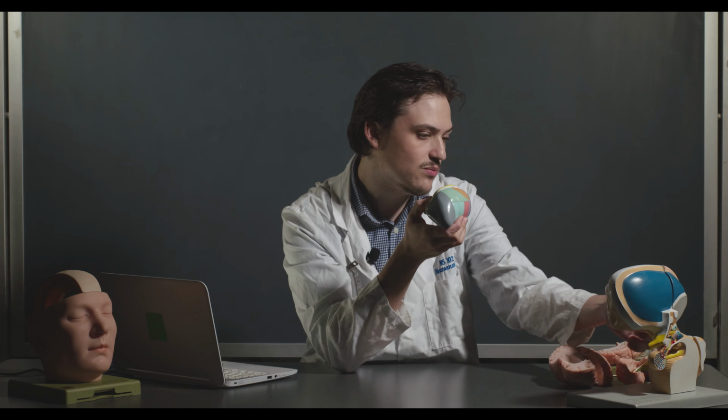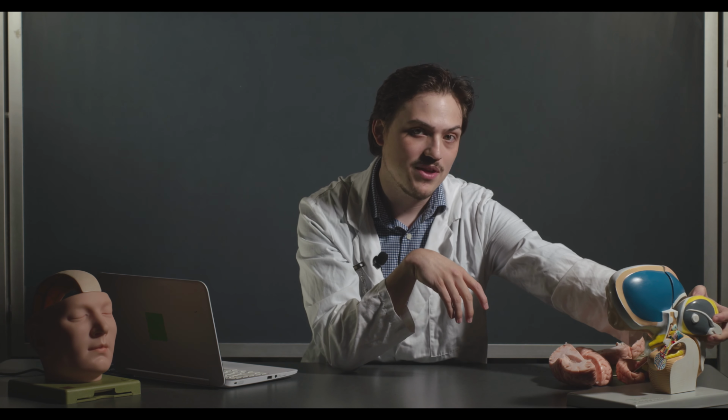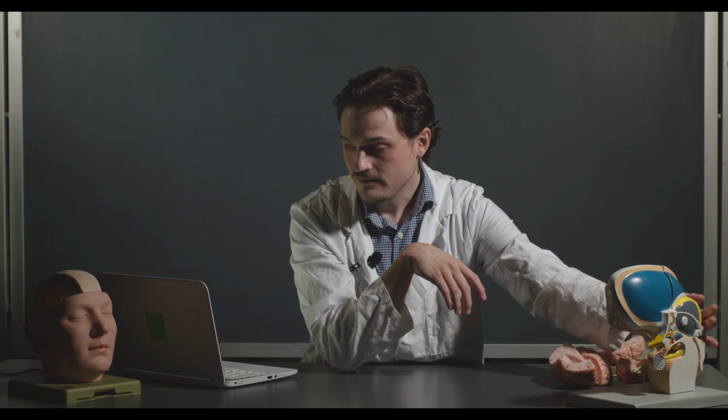I think they're actually on this one back here. But keep in mind that those ones are not on here. So if you blank on the quiz or the practicum, just remember that those 2 are not present. And with that, we are going to go ahead and go over to the actual dissection with a sheep brain.